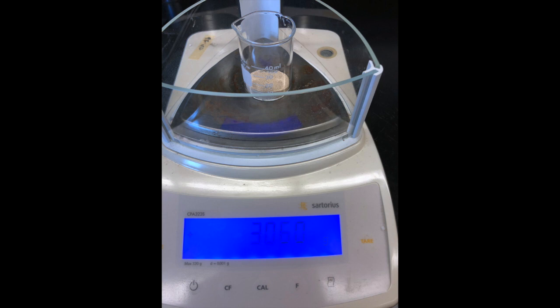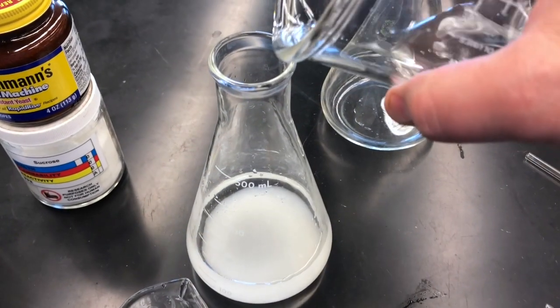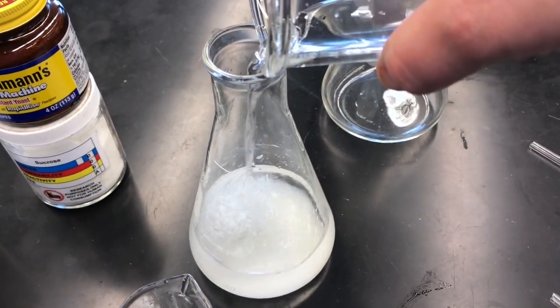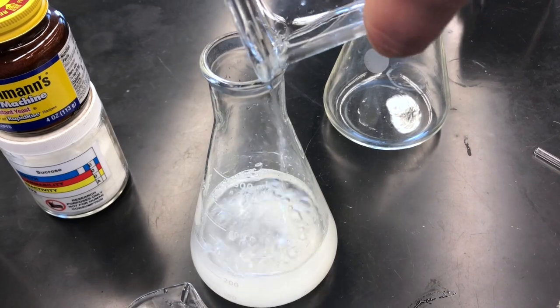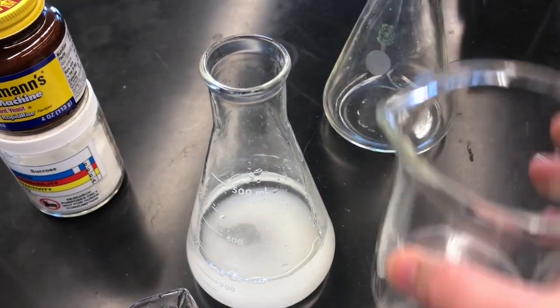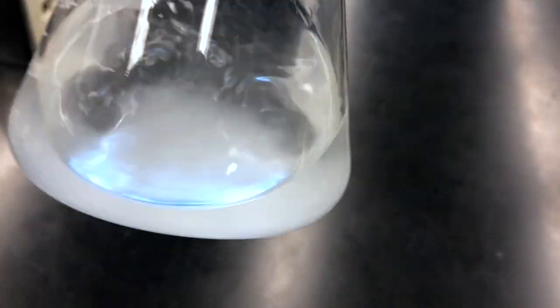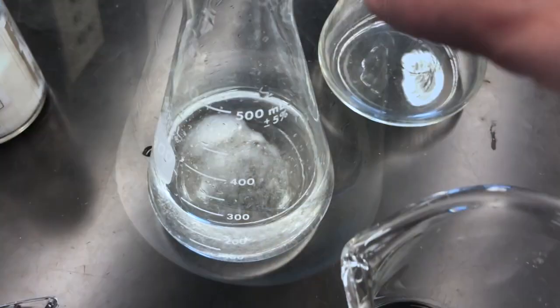Then we will add our sucrose to our flask in water and slowly add the water up to 200 mLs. 200 ml of water won't quite dissolve the sucrose initially, but we can dissolve as much as we can in 200 ml of water and then add our yeast.